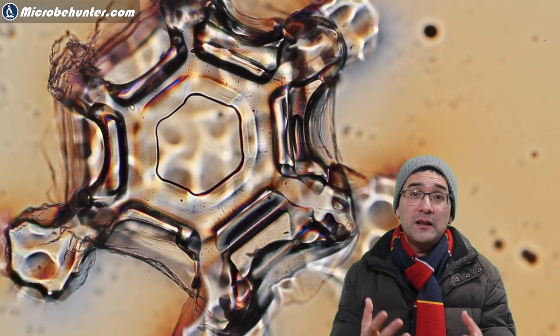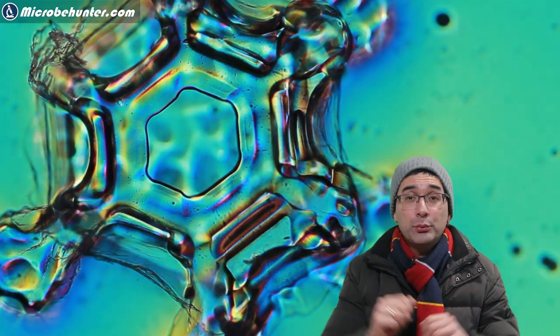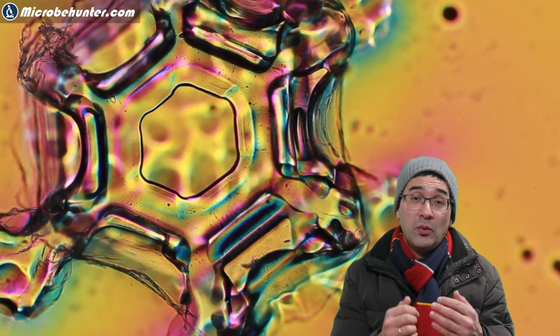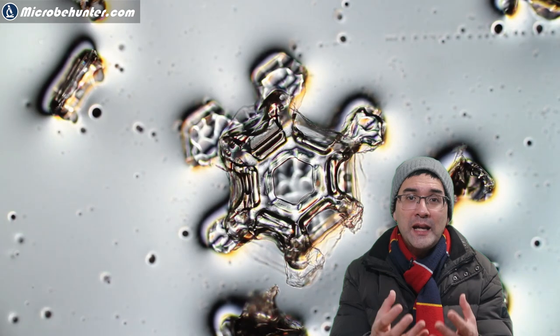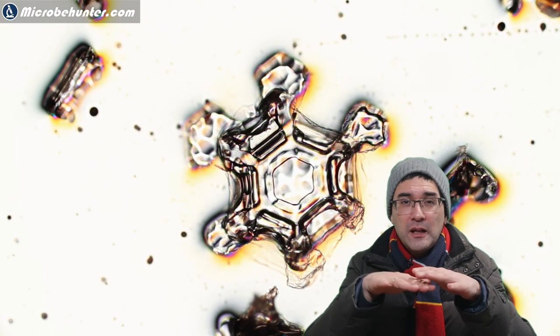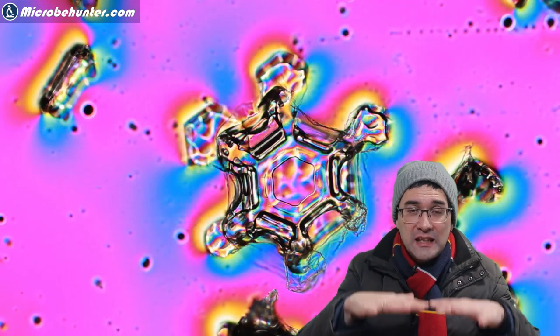If it's too thick then the snow is going to sink into the nail polish and it's going to disappear and it's not going to leave behind a nice impression on the surface. And so what I found useful is to allow the nail polish to dry a little bit so that it forms a slightly harder surface and then the snow is not able to sink into it.